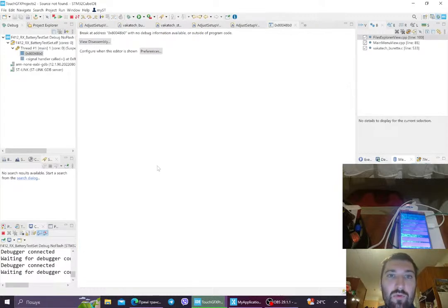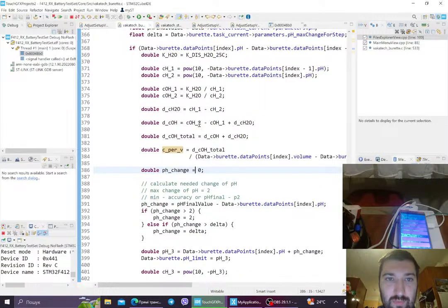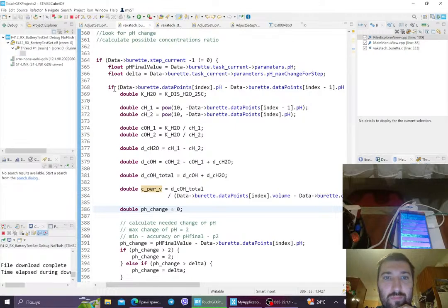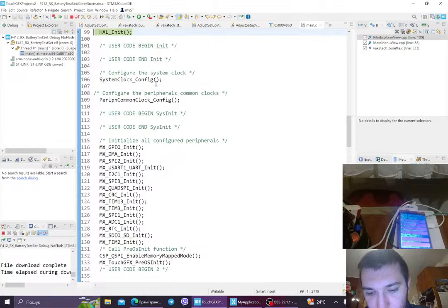You cannot add more, and the device should either calculate the titrant specifications, like it should understand what am I adding, because you cannot do it blindly, of course. You will add too much and get errors. Or it should be specified by the user. So here we've added is pH set, we've added all of this, and now we will write the function. This will be the place where we are doing this.